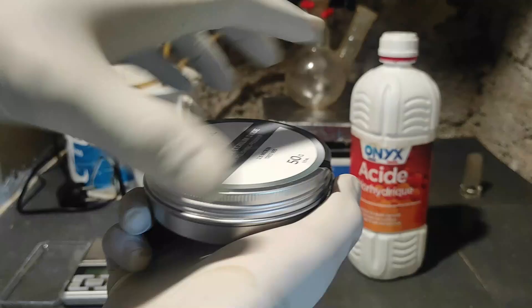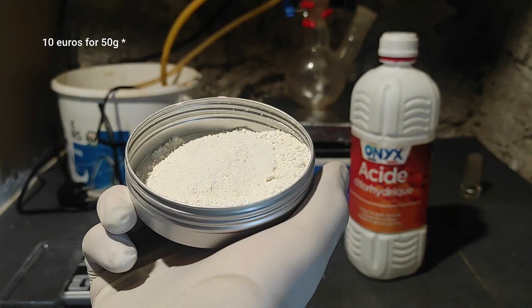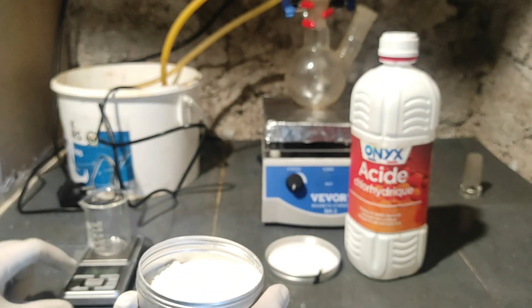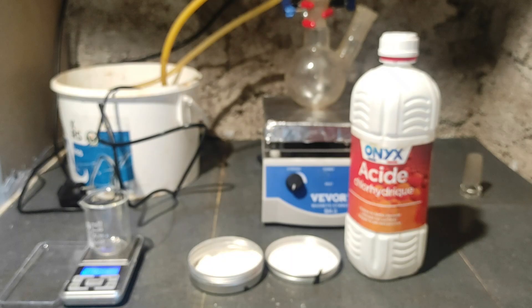The first step will be to prepare the intermediate coating between the titanium and the lead dioxide. It's made out of tin tetrachloride plus a dopant, which in this case will be cerium trichloride. You could also use antimony trichloride if you have some. I first started with some cerium dioxide polishing powder bought cheap on Amazon. It's almost white with only a slight hint of yellow-beige, because cerium dioxide can often be contaminated with iron oxide which makes it more orange — you should try to avoid it or purify it, because otherwise you won't make a good coating due to the iron impurities.